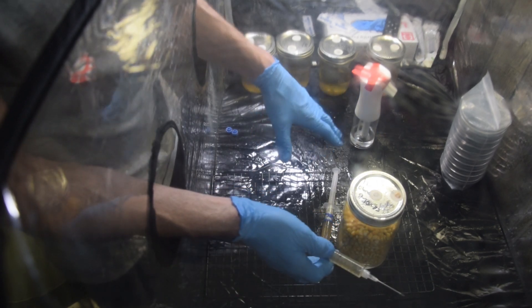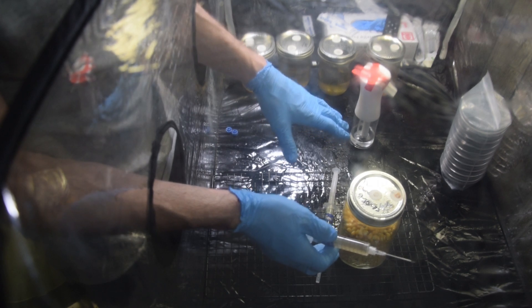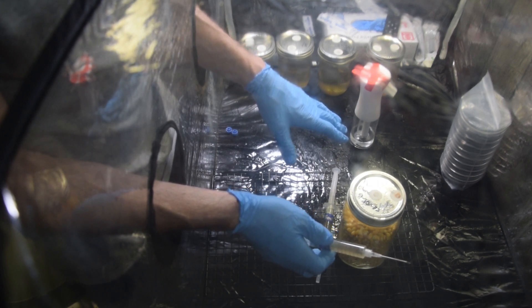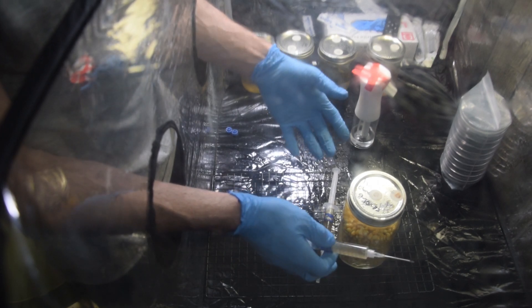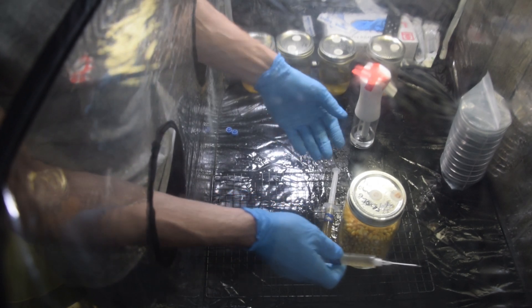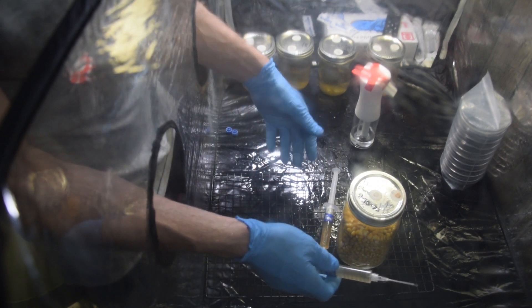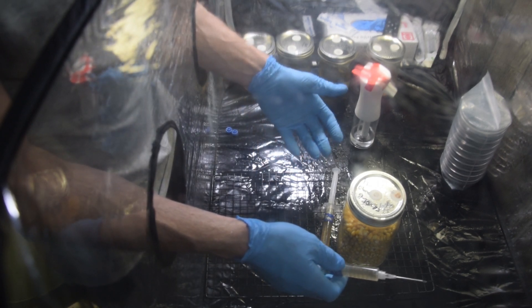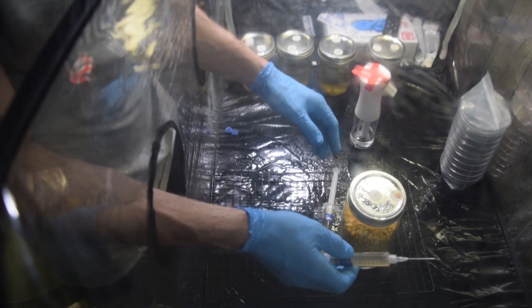You can see I actually have a pool of rubbing alcohol on the bottom that's piled up. For those of you that have been doing this for a while, tell me — what do you do? I know some people lay a rag on the bottom. A lot of people do bleach solution with a rag that they sit on the bottom, like paper towels underneath the cooling rack here. What's the most sanitary thing to do? Leave me a comment and let me know.